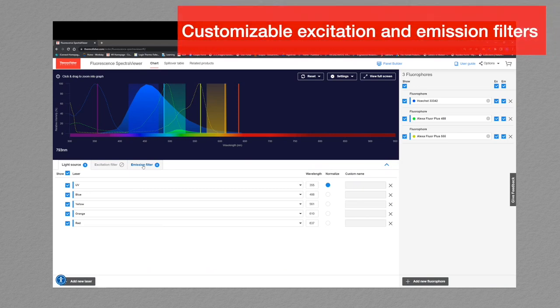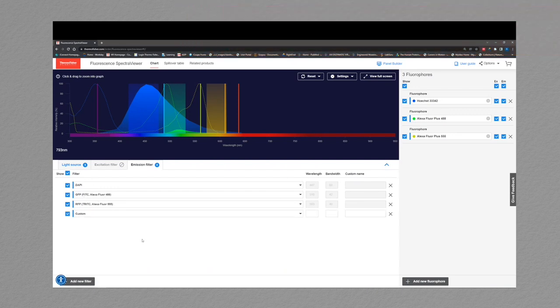choose default filter sets. So if you go into this emission filter tab, you can see that I've again pre-populated with a few filters that match up with their particular laser line. And I'll just go ahead and finish out this panel by adding Texas Red filter, and we'll add a Cy5 filter. In step 3, we need to choose our fluorophores that will work with our system.